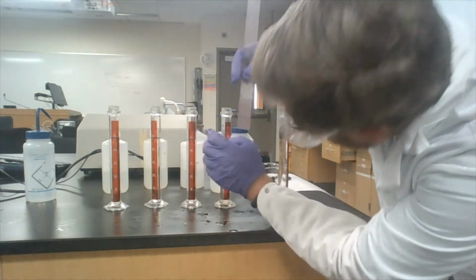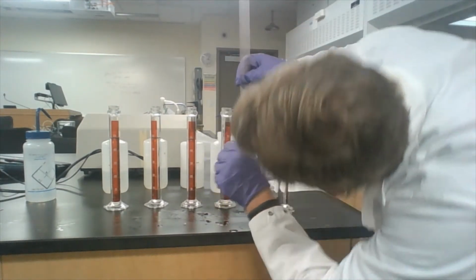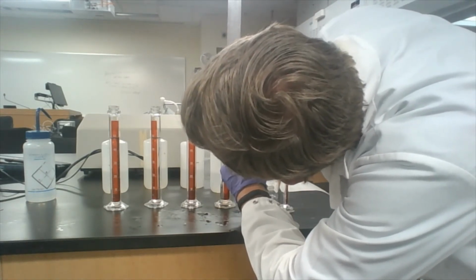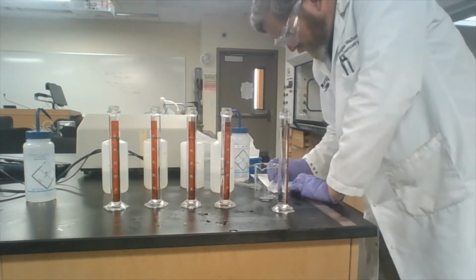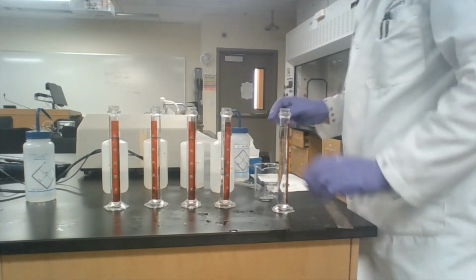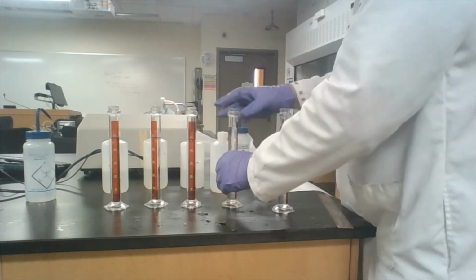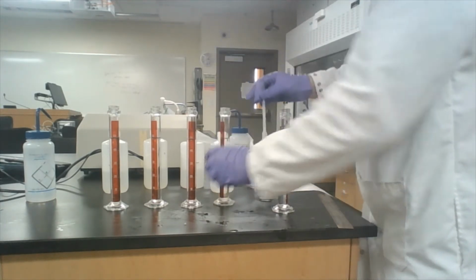distance from the top of the water line to the top of the pipette. And of course, it's not easy to see. So that is 28 millimeters. Okay, and somehow you got to get it back out of here. It says, no, I want to stay.